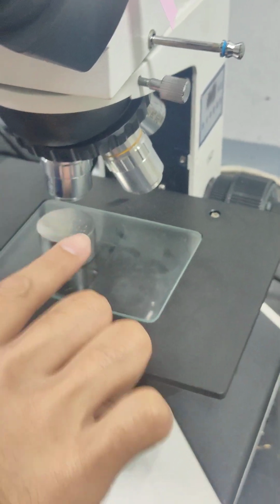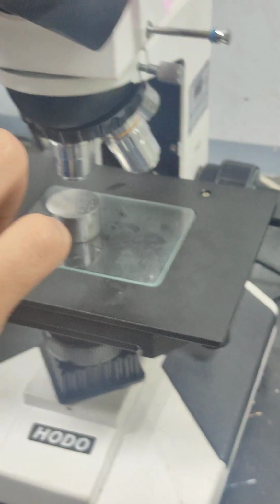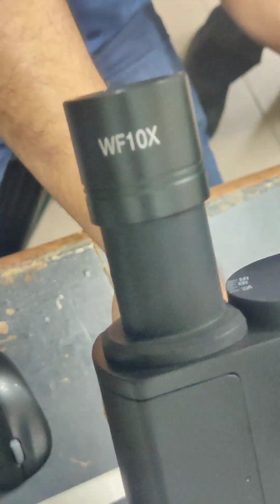Now we can. Here's the specimen. To adjust it right on the center of the lens. We're using 5, that's for reading the surface of the specimen, times 10, if I'm not mistaken. Oh, here, 10x. Can you show for the camera? Yeah. It says 10, so that's 10 times the 5 magnification.